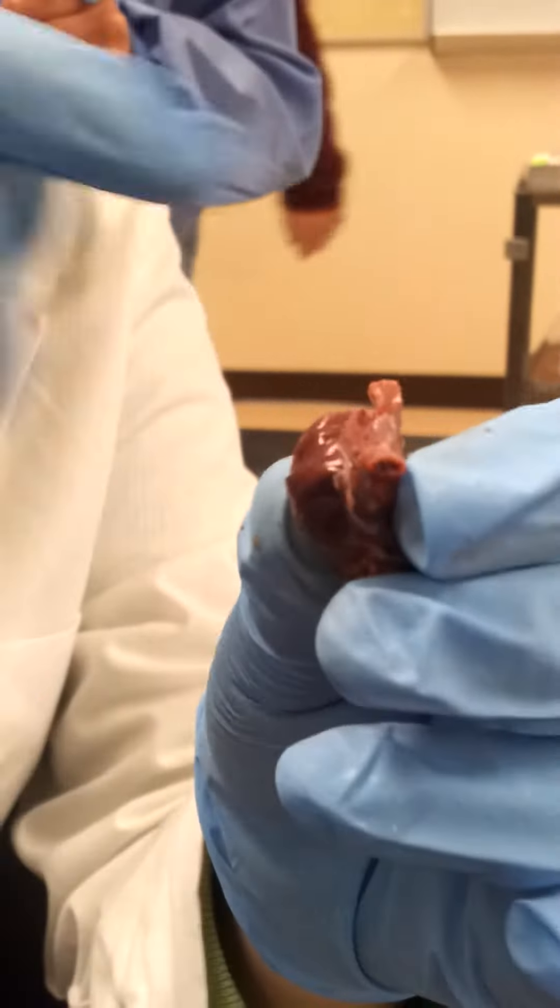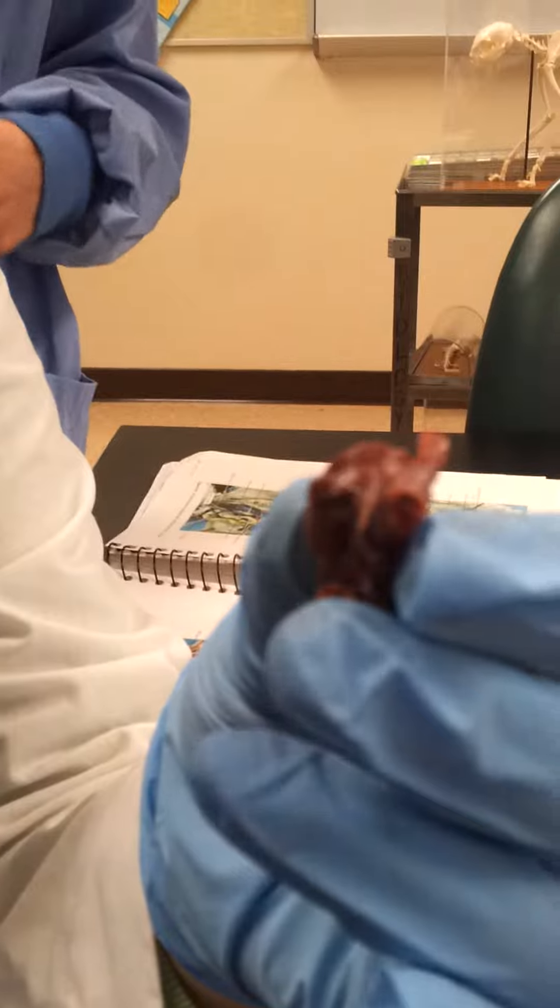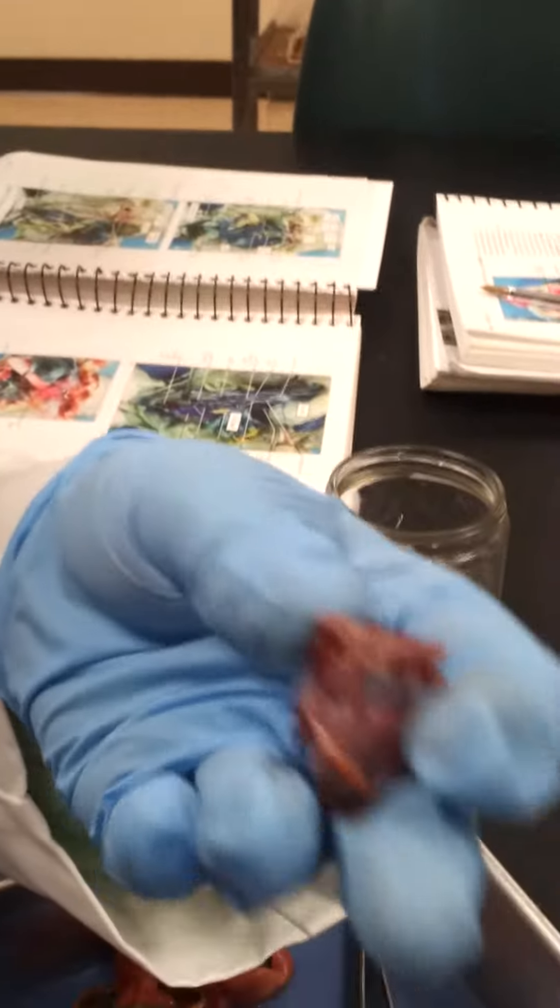One of those holes goes down to the bottom, and one goes to the top. Some very useful information. This is the heart of a frog, by the way — a muscular, small piece of the organism.